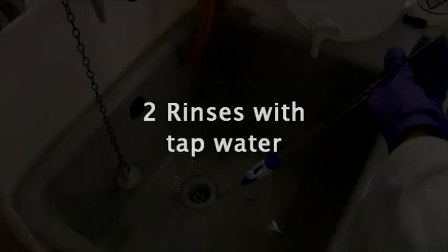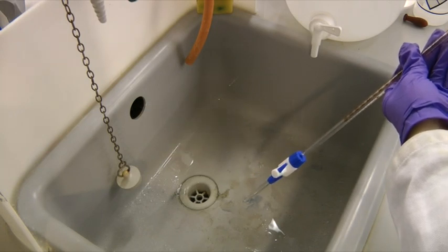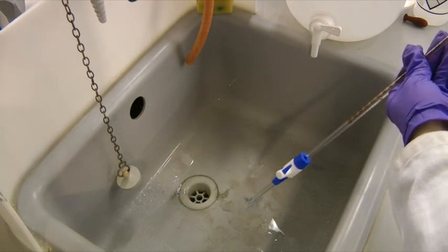We're going to go through the process of setting up a titration. Firstly, the burette should be rinsed twice with tap water. Note that we're doing this in the sink in this case, but you should follow the instructions given to you by your teacher.